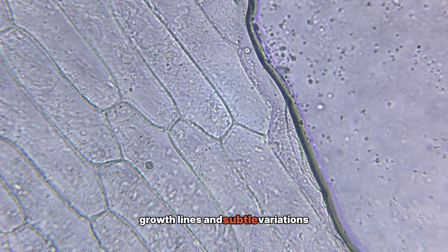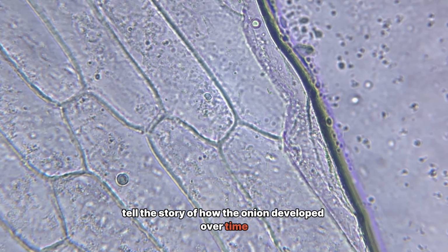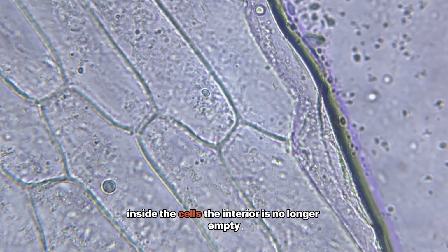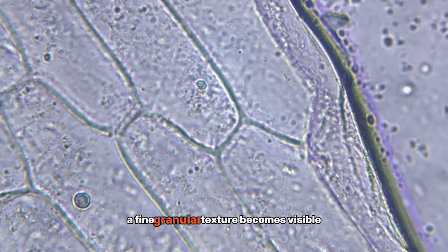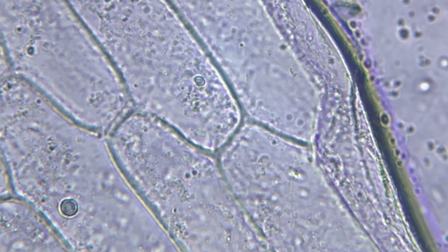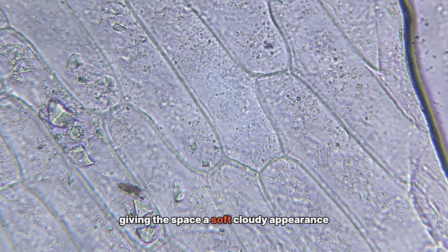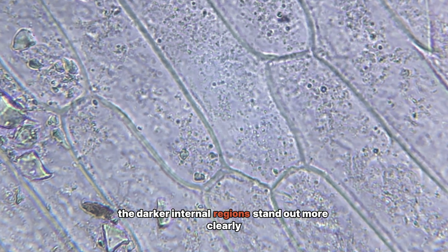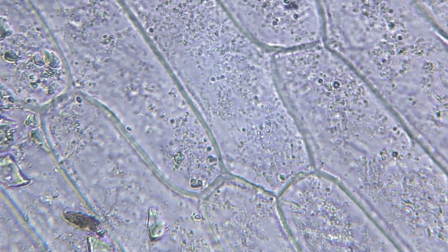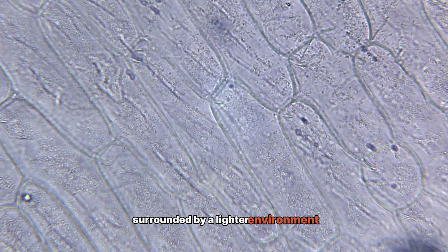Growth lines and subtle variations tell the story of how the onion developed over time. Inside the cells, the interior is no longer empty. A fine, granular texture becomes visible. Tiny particles are suspended throughout, giving the space a soft, cloudy appearance. The darker internal regions stand out more clearly. They feel anchored within the cell, surrounded by a lighter environment.